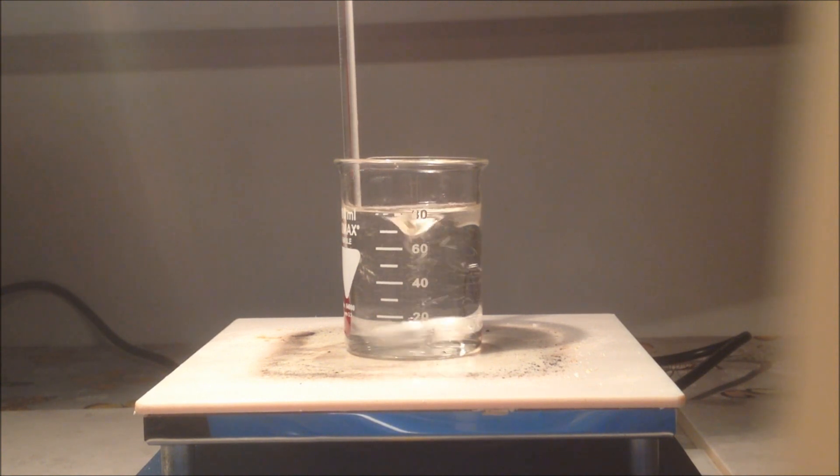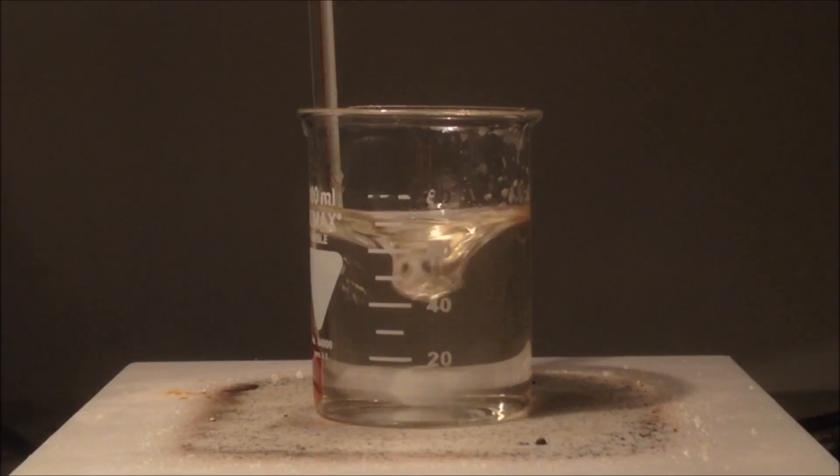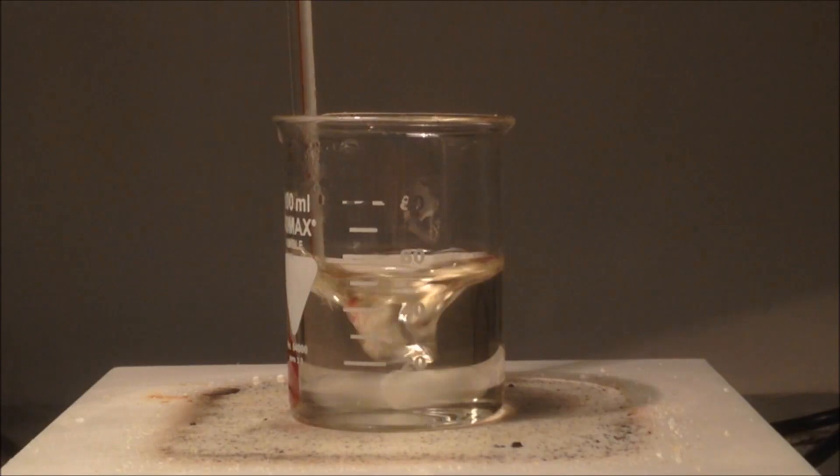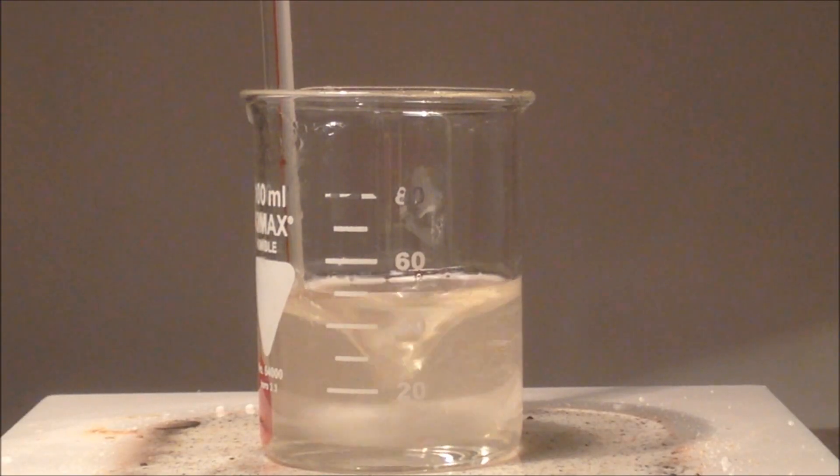You know when it's concentrated enough when you start to see precipitate forming as you're evaporating away. I've used a fan to help this up and provide a bit of a current. You can see here you can still see through the solution a little bit, but you can see white precipitate slowly forming there, it's going more and more opaque.